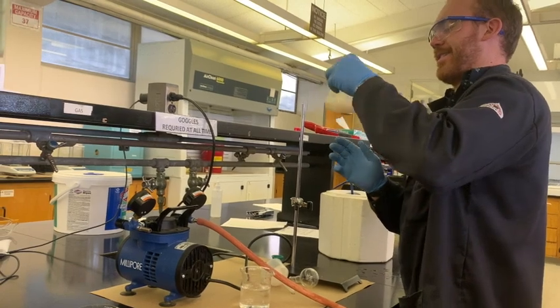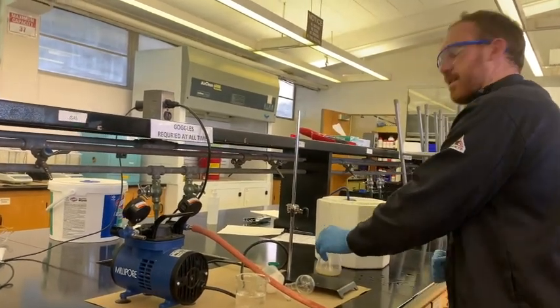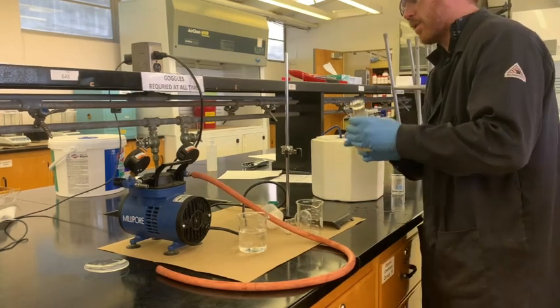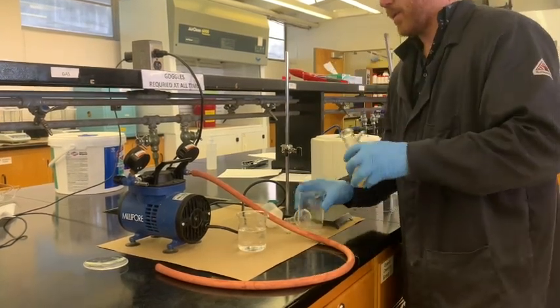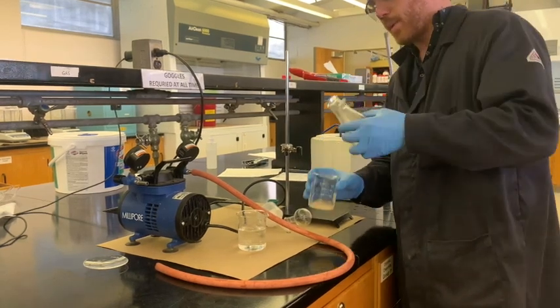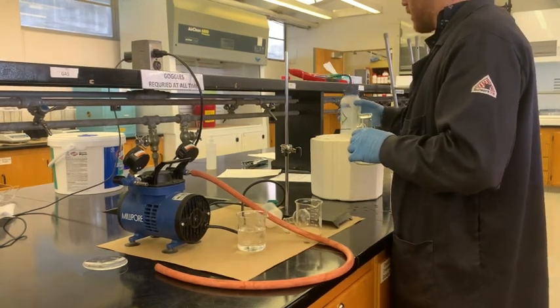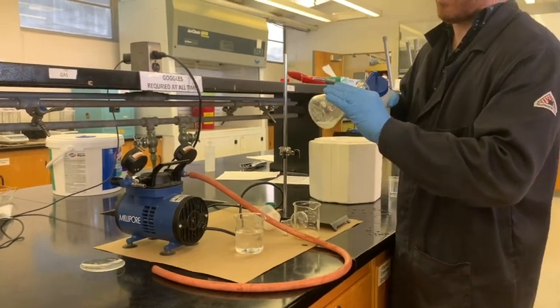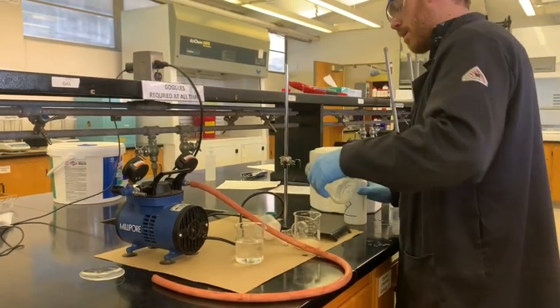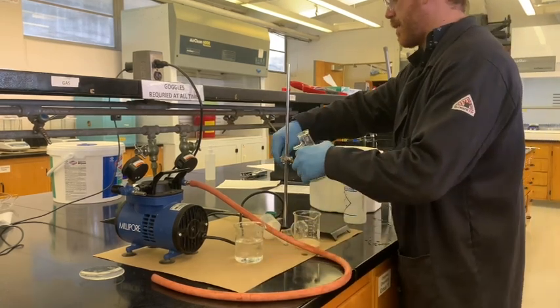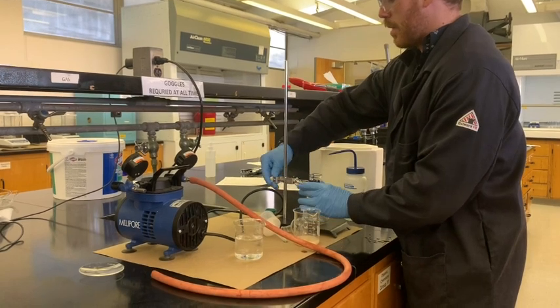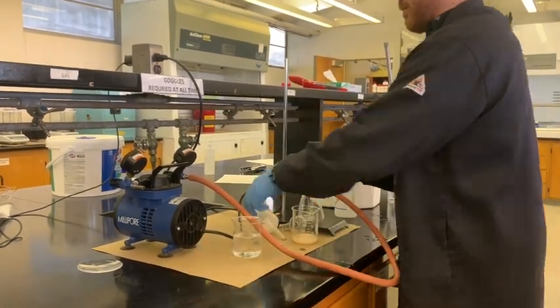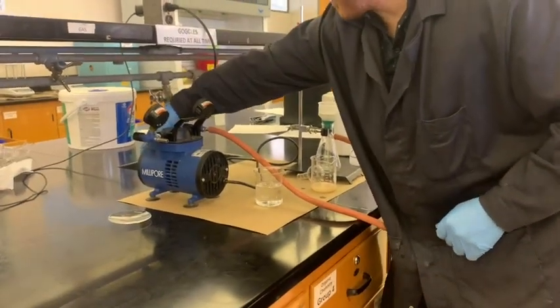Now it decides to become chunky. No worries. Couldn't find another sidearm flask. What I'll do is I'll just transfer all of this into a clean beaker and make sure I rinse out all of the other material. Don't want to lose any of that product. You want to get maximum yield if you can. We're going to put the sidearm flask back in place. Sometimes this stuff just happens. You just got to figure out how to deal with it.